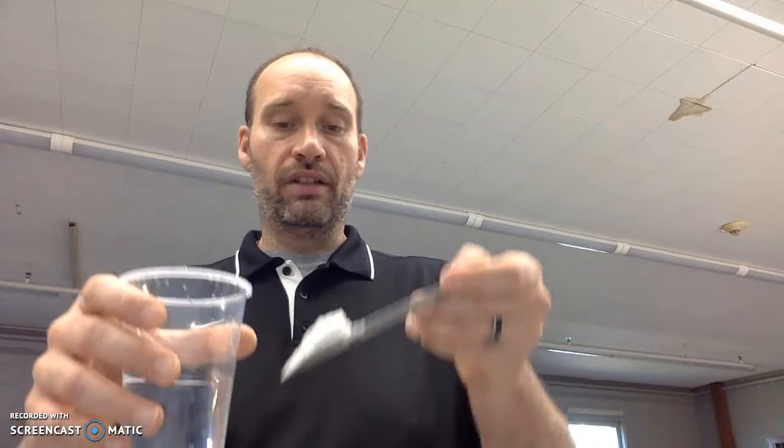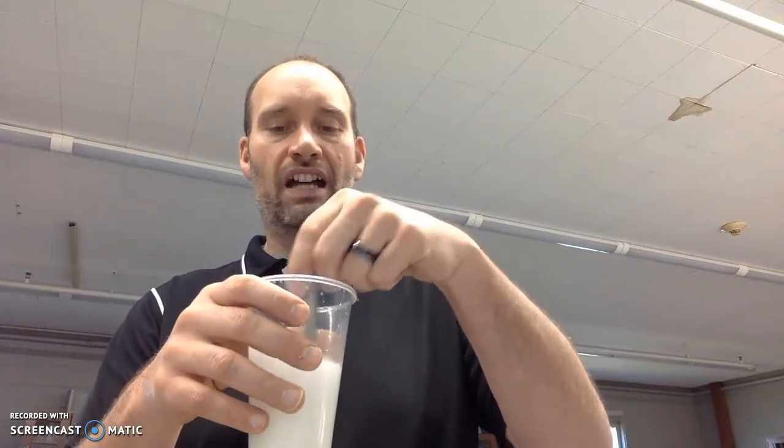The first part is how iodine is an indicator. It's an indicator for starch. So what does that actually mean? That means this. I'm going to take a beaker with just water and put starch in it. Of course, I'm going to mix it around. It looks almost like milk. I'm going to make sure there's enough starch. I want a lot in there. This is just to show how iodine indicates in the presence of starch.